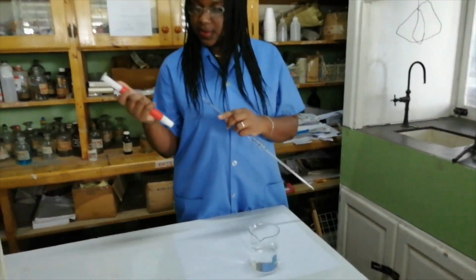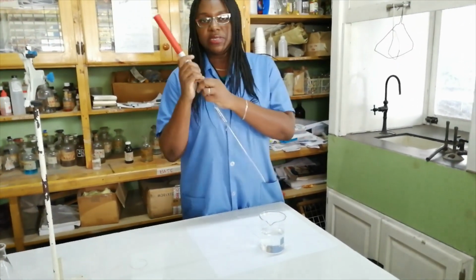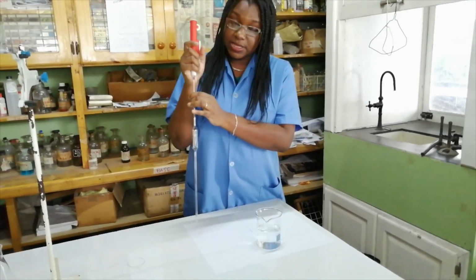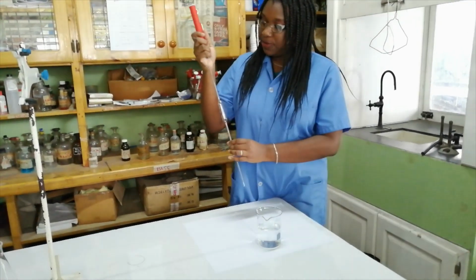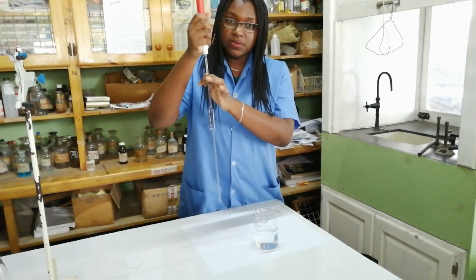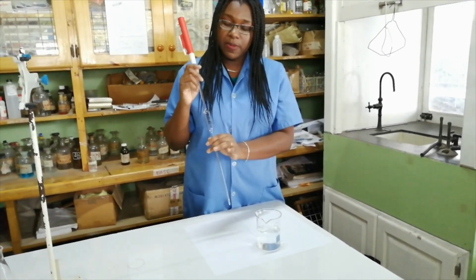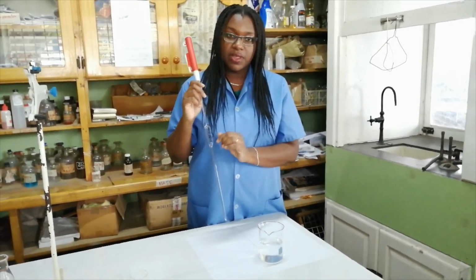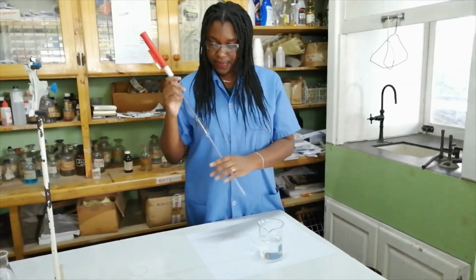Let us attach the pipette filler to the pipette. We're going to do it securely. You're not going to force it on and break it. No, you're not going to do that. So what you're going to do is just gently put it on, and you should not hold it like this, no, because it might fall out. We're not going to hold the bulb. This is the bulb of the pipette. We're not going to hold the bulb because our body heat can transfer and heat the liquid that's on the inside of it. And sometimes it's not just water that you'll be using in the lab.